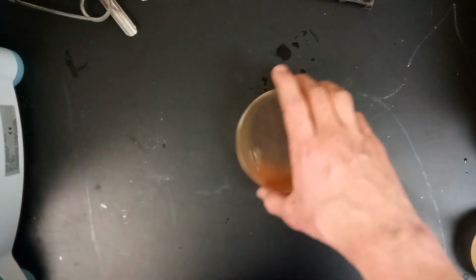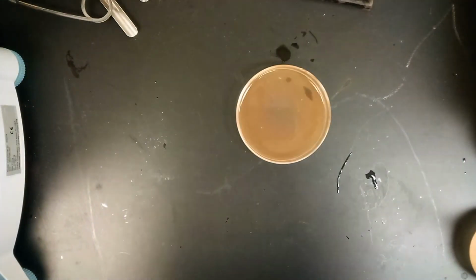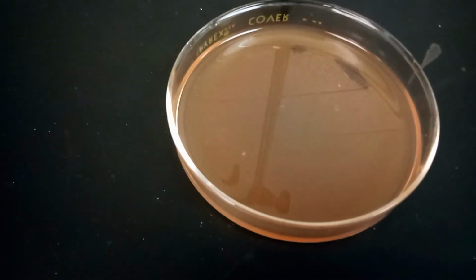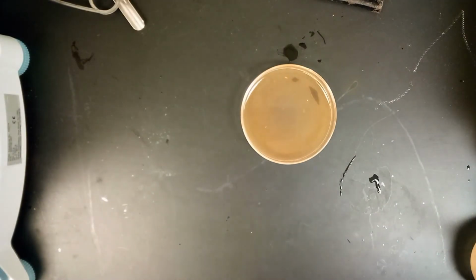Again, the potassium thiocyanate didn't do much, but when you swirl it, you'll see that the two mix and form this orangish shade. We expect it to be dark red, but there was more potassium thiocyanate, so it turns a little bit clearer, if that sort of makes sense.